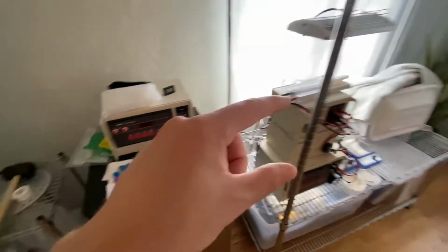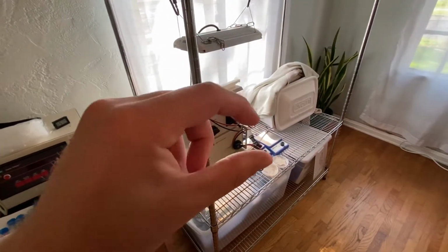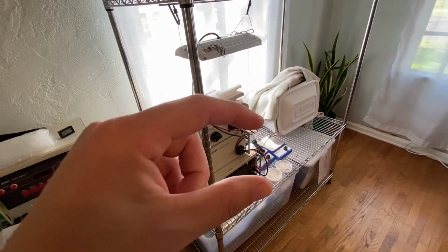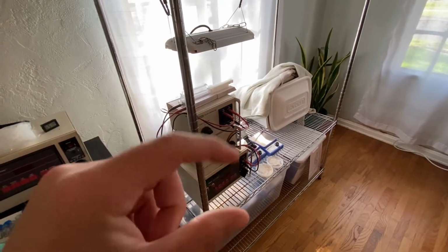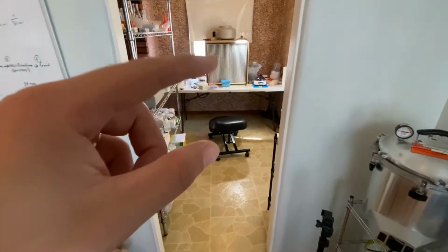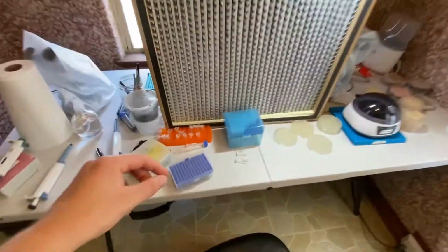electroporating them, recovering them, and putting them in the incubator, because after a couple of hours, usually I can look in the tube and I can see that there was growth. But on the couple of ones that I plated, it didn't look like a whole lot had grown. However, the one that we tried today and we confirmed actually worked, that one actually did have some outgrowth.